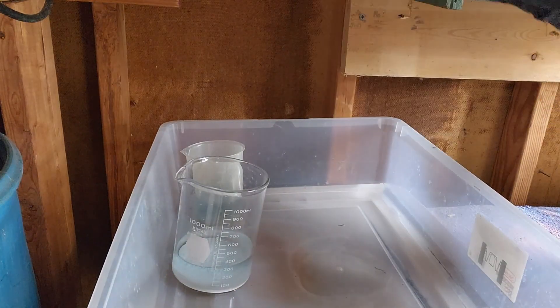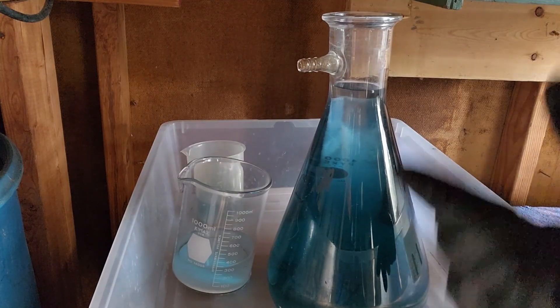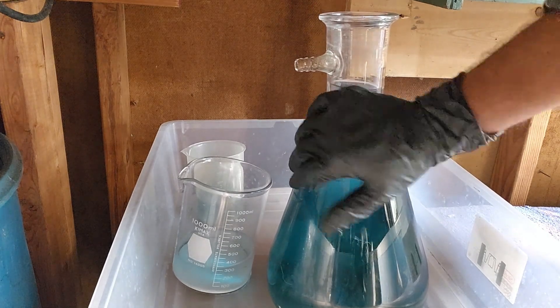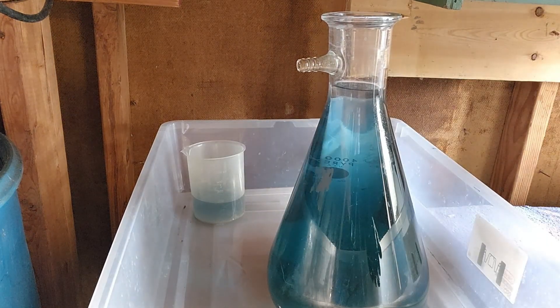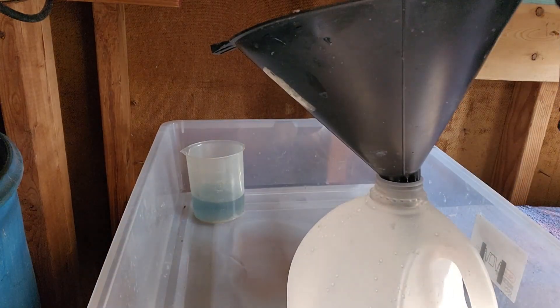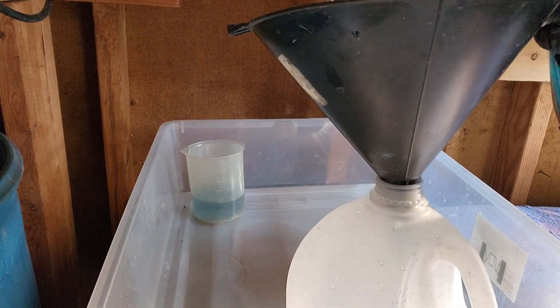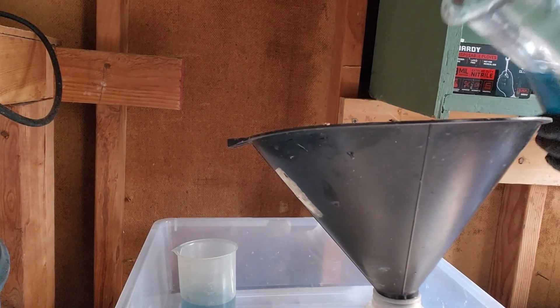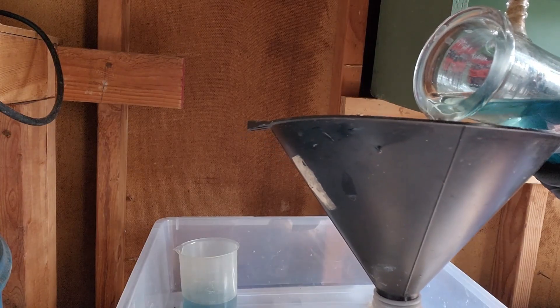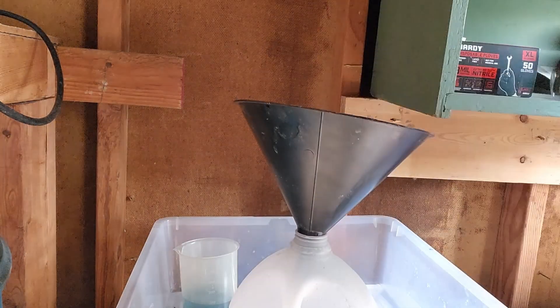And right there - remember when I told you I was really bad at making videos? That's it right there. You were supposed to get to see the silver precipitate down on the bottom, but I diluted the whole thing and precipitated the silver chloride off-camera. What happened was I had my phone set to photo and not video, so when I pushed the button it took a picture instead of hitting record. Like an idiot I didn't even realize it until it was done.